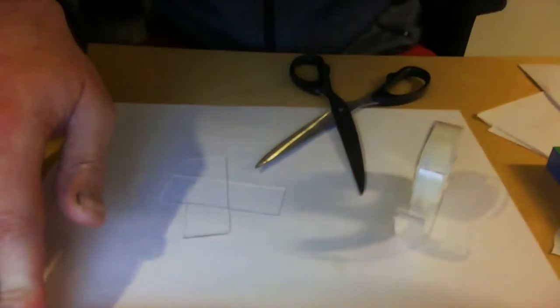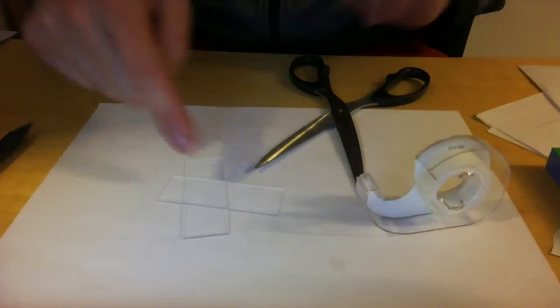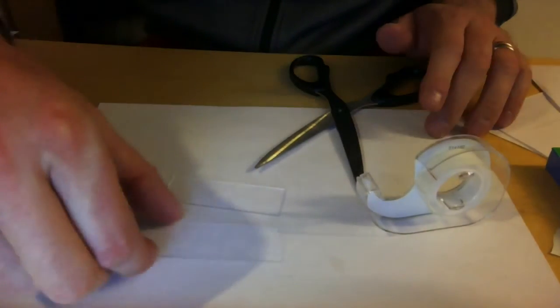But of course, when we make microfluidic systems, we want to make systems that hopefully are a little bit repeatable. And perhaps the very simplest way of doing that is what I'm going to try to do now here in front of you. It's something I've never done myself before. I'm going to use for this a double-sided tape, two pieces of glass, and a scissors. Never done it, so I don't know if it's going to work. It's going to be a little bit interesting.